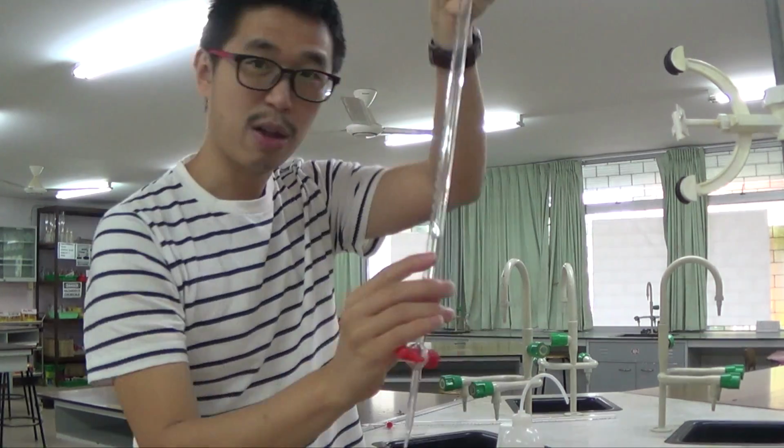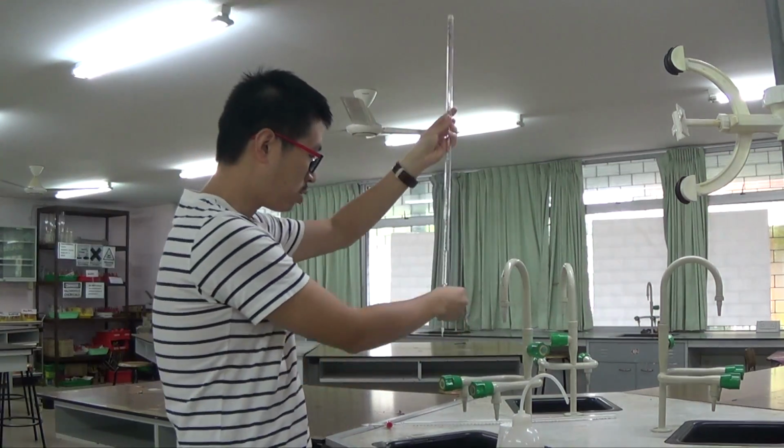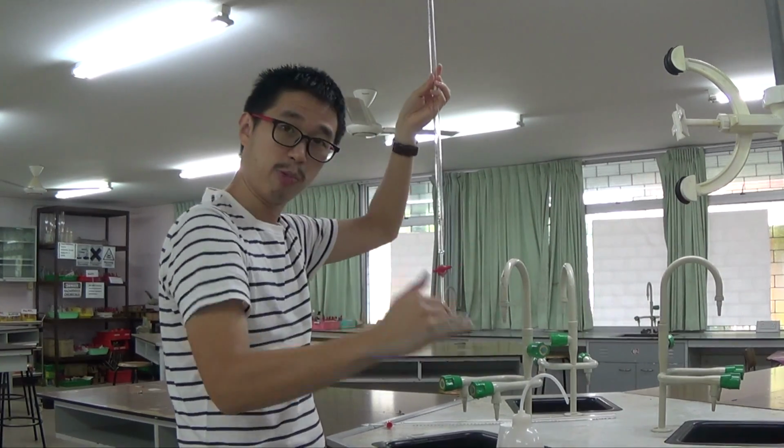Okay, I don't need a lot for washing, so it will take around 5 cm³ then. Make sure you allow it to pass through the bottom because you're washing the bottom bit with this solution as well. White background behind it.